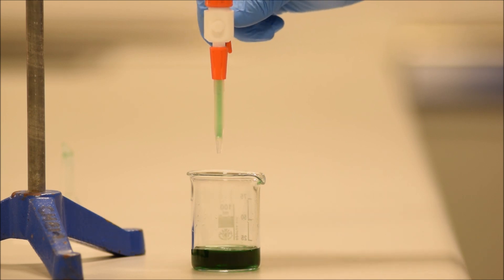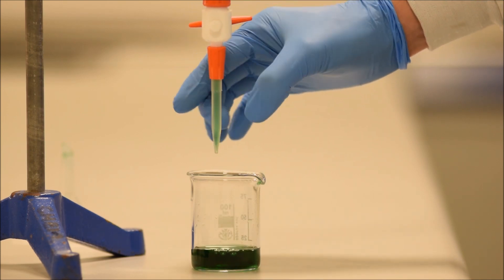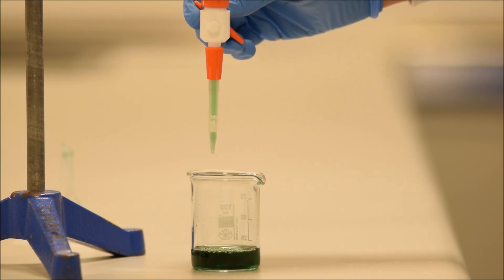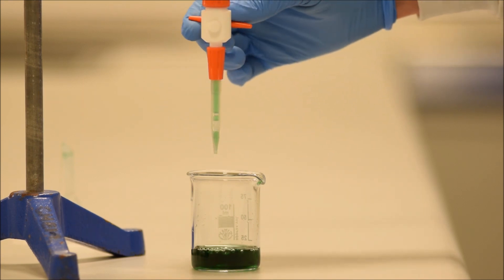Before you start using it, you've got to make sure that the nozzle doesn't contain any air. So you can see it's filled up there with green liquid, but actually, there's air bubbles in it. So give it a bit of a flick, and they'll start working their way out.